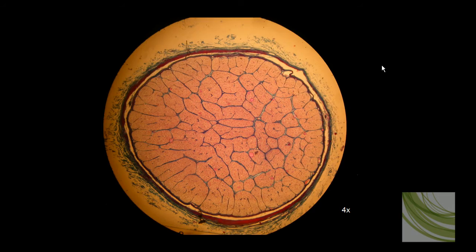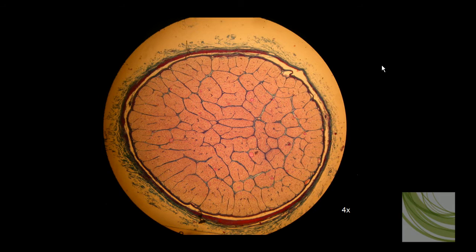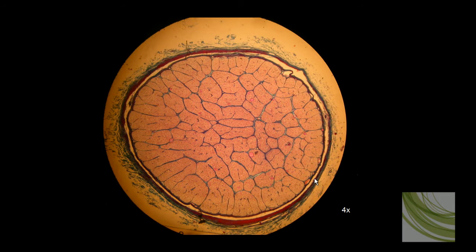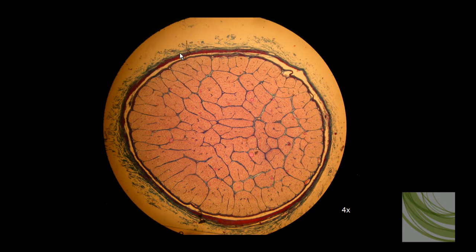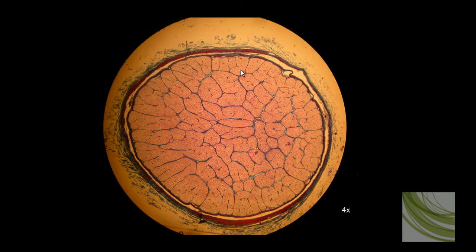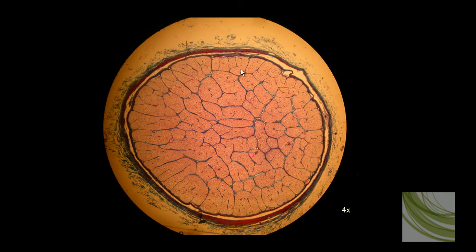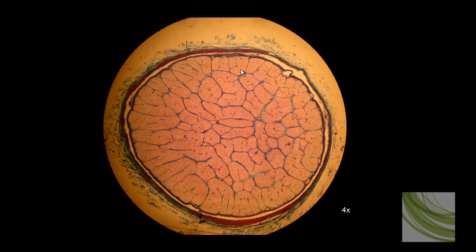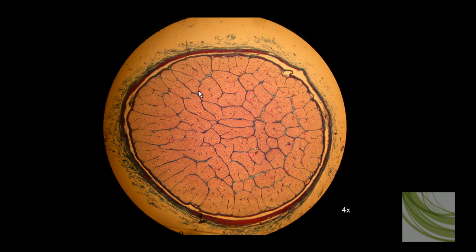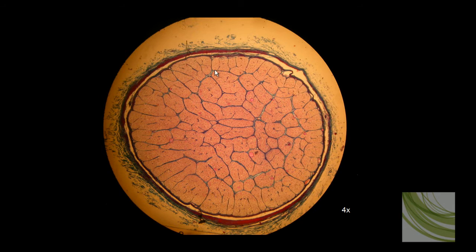This is the first slide I want to look at. We're going to use the 4x objective to magnify this cross-section of a nerve fiber. Even at 4x we can see some very interesting things. We can see the tough outer covering, which is the epineurium, and then we can see fascicles bound in perineurium. We really can't see any endoneuriums or nerve fibers yet, although we can see some venules and some capillaries scattered throughout the nerve at this magnification.